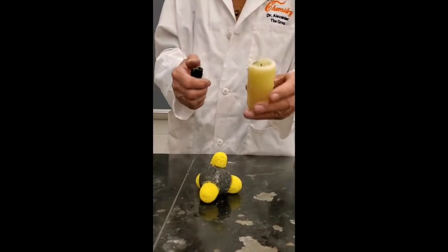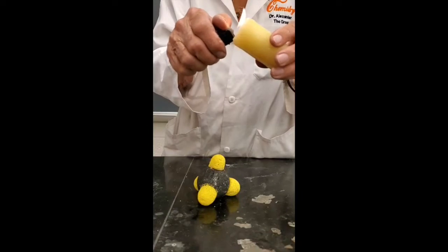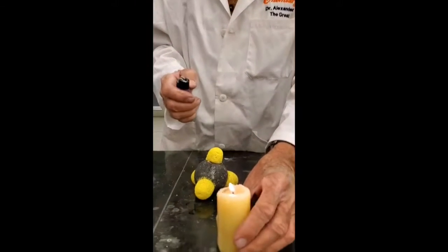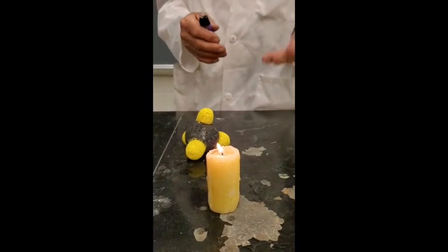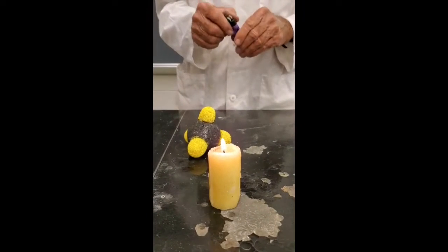But all hydrocarbons have something in common. They're all flammable. And so I can actually light that wick, and the vapors come off of the wick and they'll start burning. Same kind of reactions occurring. All the carbon atoms in there end up in carbon dioxide, and all the hydrogen atoms end up in water vapor.